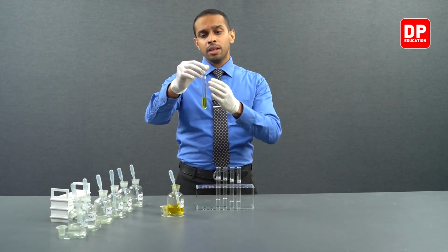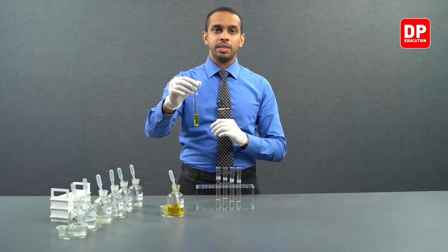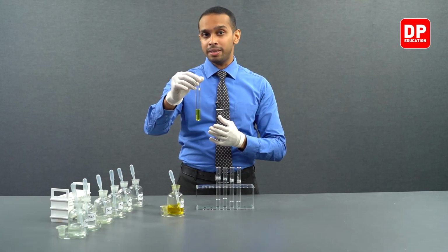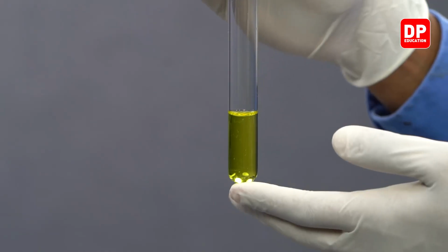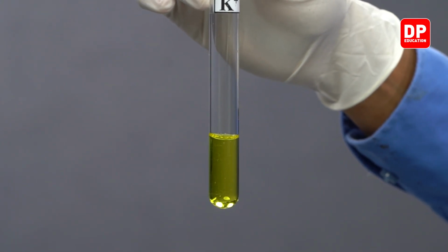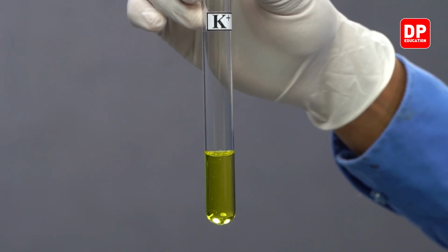This indicates that potassium plus ions, when coming into contact with chromate anions, will not form a precipitate. However, since potassium chromate is soluble in water, you will have chromate ions in the medium. Chromate ions have their characteristic color, which is the yellow color present here as well. Just like in sodium chromate, over here in this solution as well, chromate ions are present without forming a precipitate. So therefore, the solution is yellow in color.